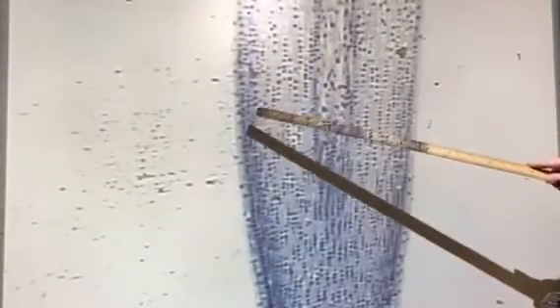On your slide, you're going to have three of these, lined up next to each other. Pick one. It doesn't matter which one. When you see the whole root tip, you want to get down to where the end of it is tapered, and then back off a little bit. This is where the mitosis is happening the fastest, so this is where we're going to see the most stages of mitosis, all that PMAT. So get it focused on low power.